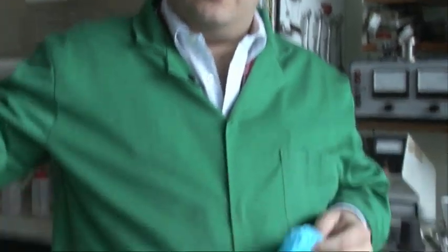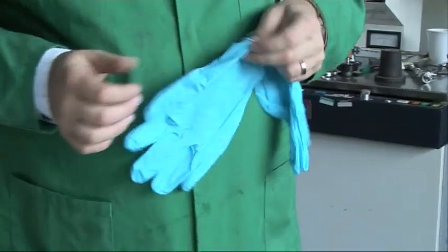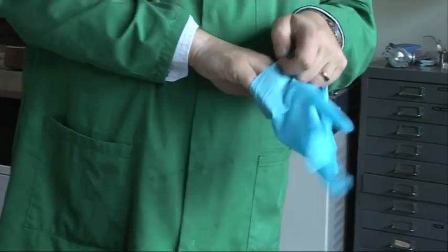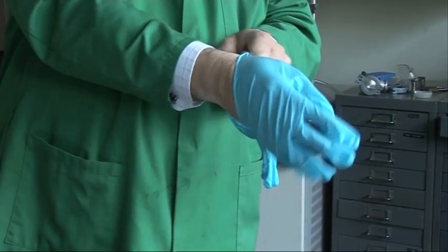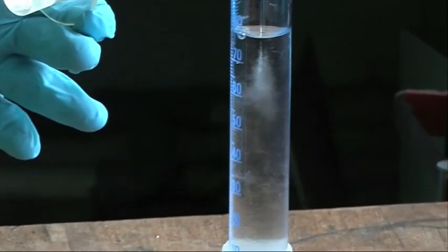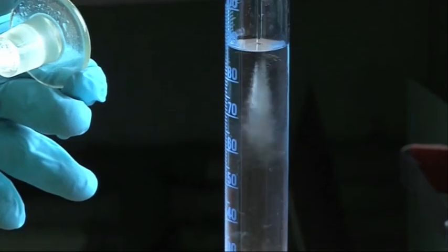We're going to take our molten gallium and put it underneath a layer of dilute sulfuric acid, about the same strength as battery acid. So now we're going to make the acid. And to do that we're going to dilute concentrated sulfuric acid with water. Now it's always important to remember that when you dilute acid, you always put acid into water. Because the reaction can be exothermic and we want to dissipate the heat in the water, so that it doesn't squirt up on our faces.